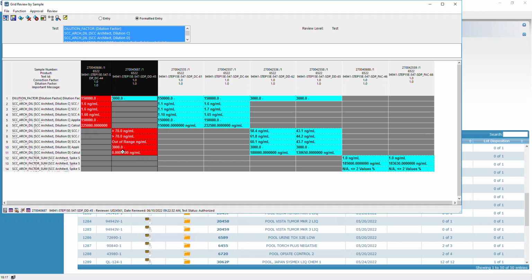A 0 is not considered a good value for a spike solution, so the system only uses the good values, and so the factor sum, since the conversion factor is 1, the factor summary should have been 225,000.